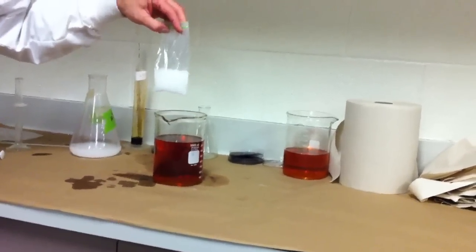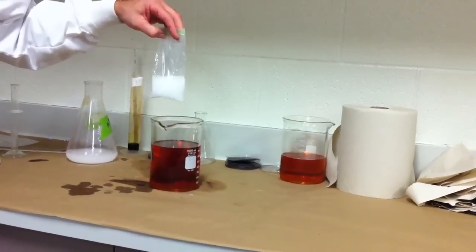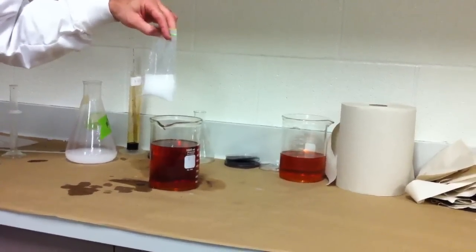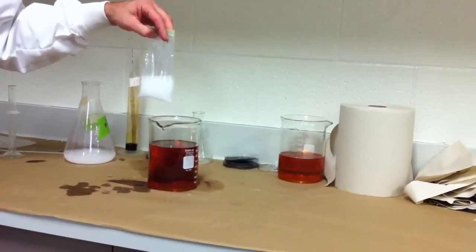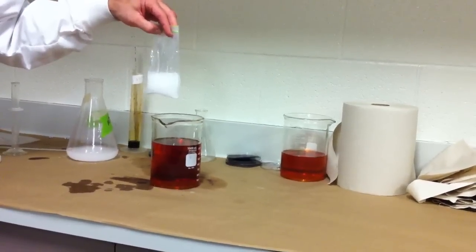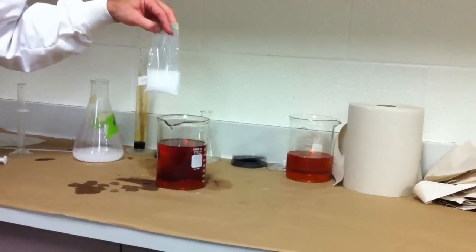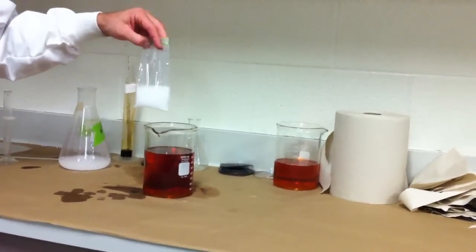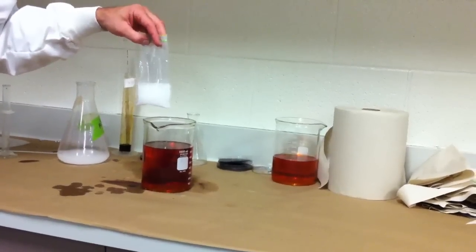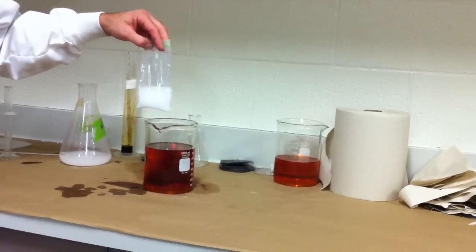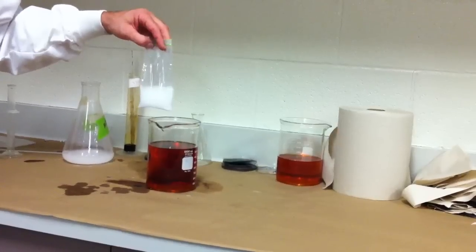If we believe this to be a hypotonic solution, we could say that the bag goes in there and it's going to fill up until such a point as that it pops. If it's a hypotonic solution, what if it's not hypotonic? It'll just do nothing. It's possible that we'll have no response at all.